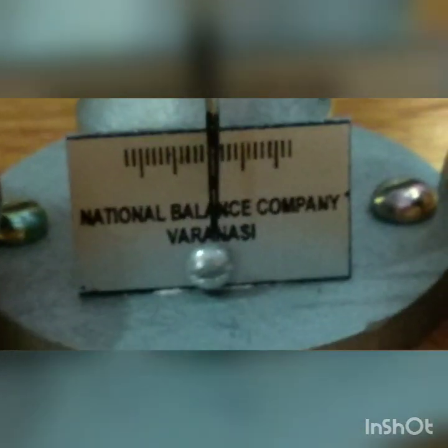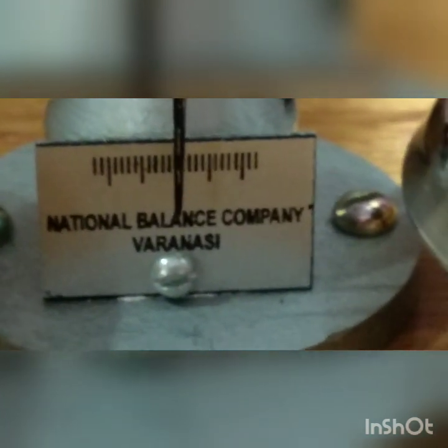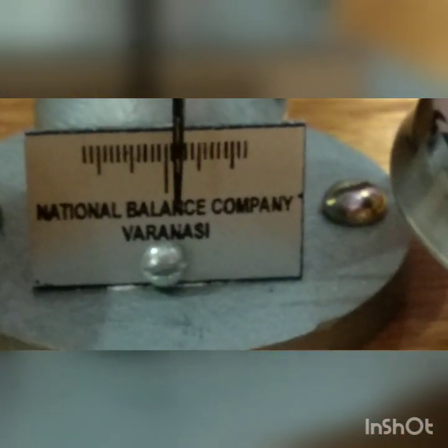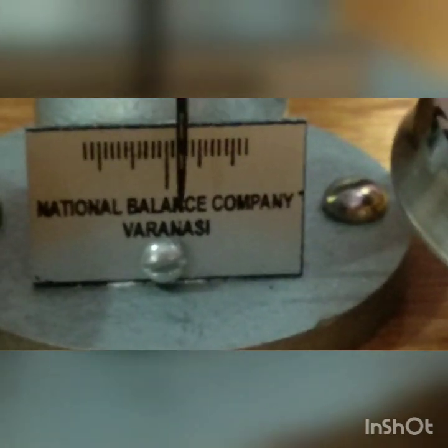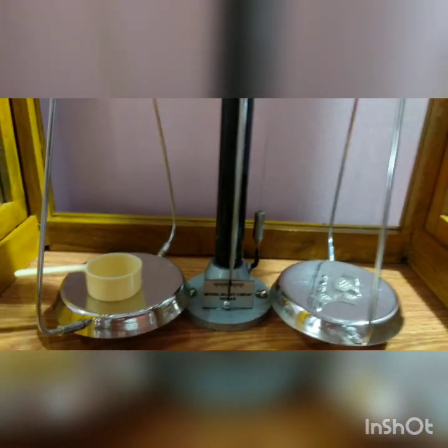Now check again. Here it is going 1, here it is going 1 and a half. Now we can conclude that our weight is accurately measured.